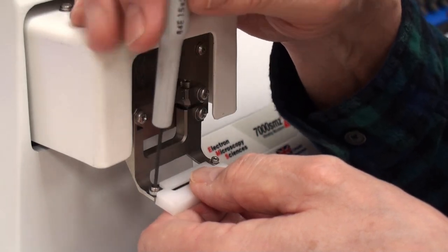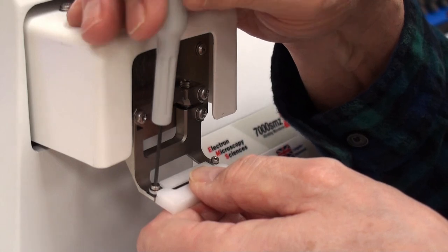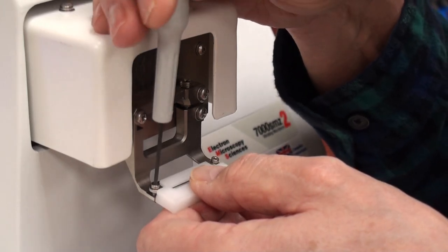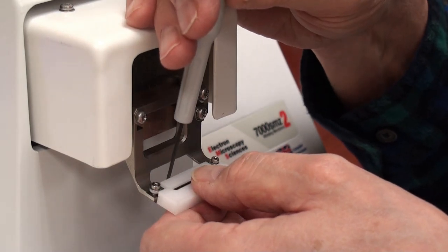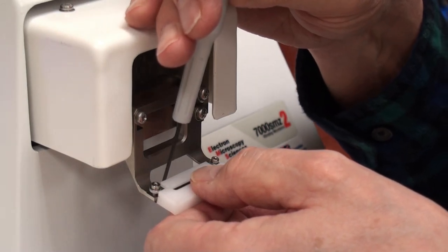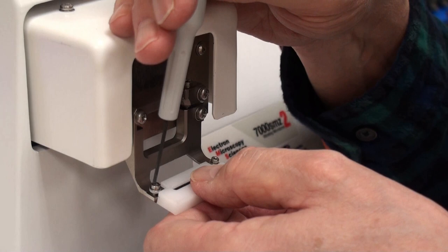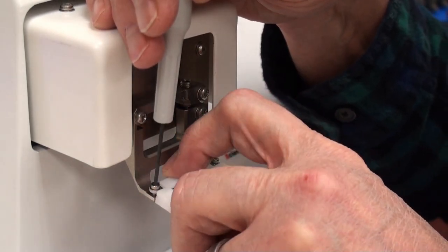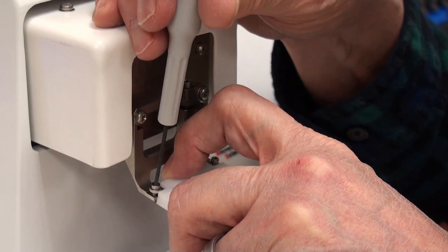And yes, even I have to think about which way is used to tighten this screw. And because it's opposite, so it's turning to the left.